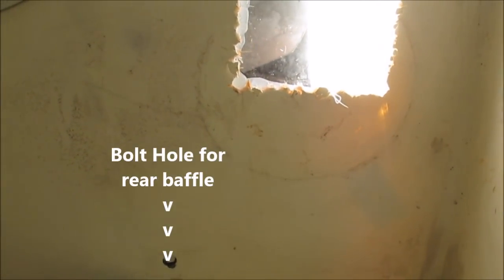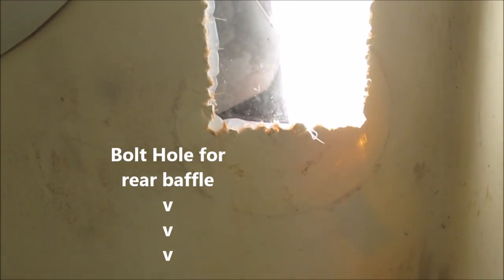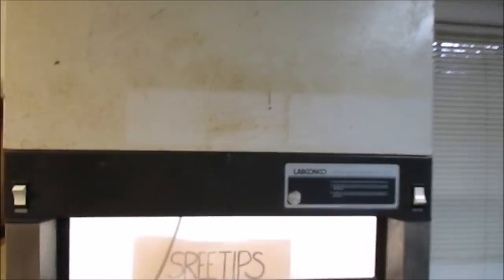I don't know if you can see there, that round circle on the end is where the old light was that was dropping the stuff on my work. I just went ahead and I had to cut the bolts from the other side and pull them through, because the bolts to take the light off were inside the globe, and I couldn't get the ring off to remove the globe to get to the fasteners that was holding that light in place on the ceiling here. Now I'm going to show you the modification from the top view on top of the Fume hood there.